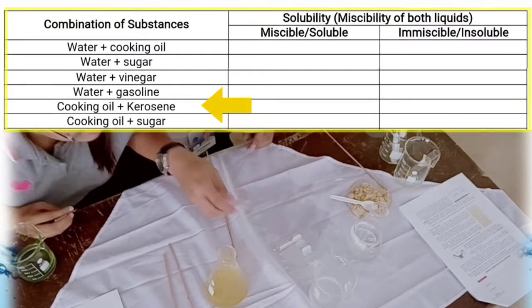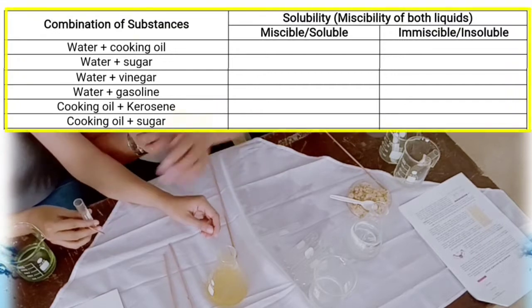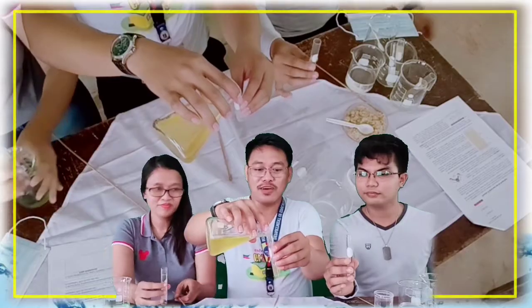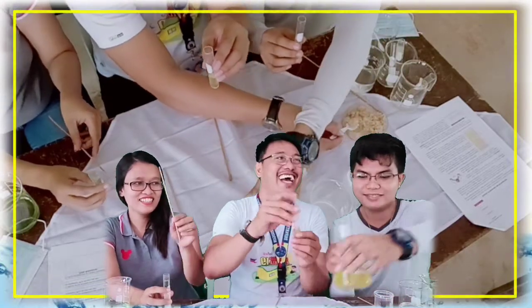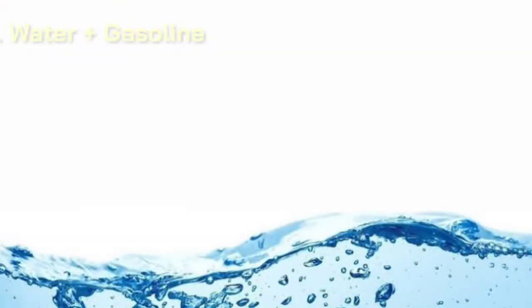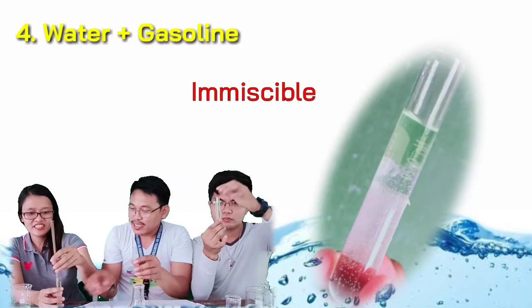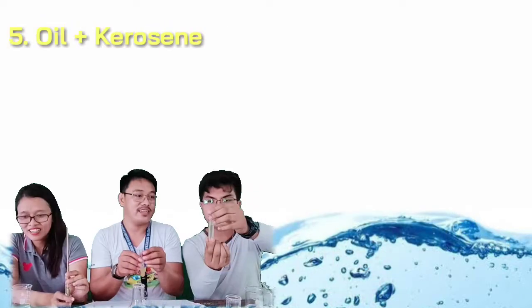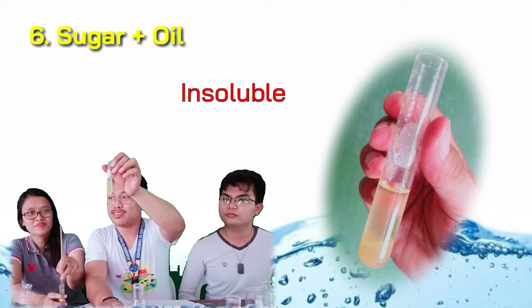For setup number four, water and gasoline: it is immiscible. Setup number five, cooking oil and kerosene: they did mix, therefore the compound is miscible. For setup number six, cooking oil and sugar: it is insoluble.